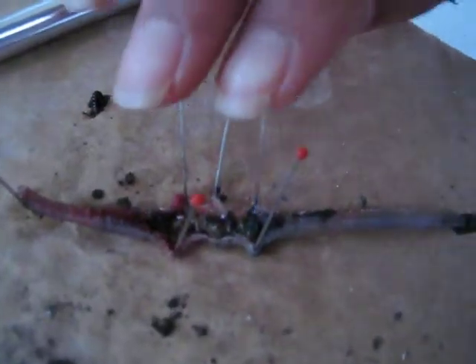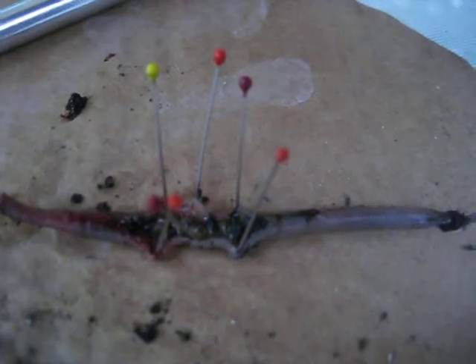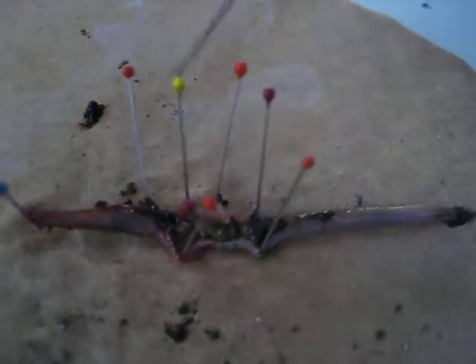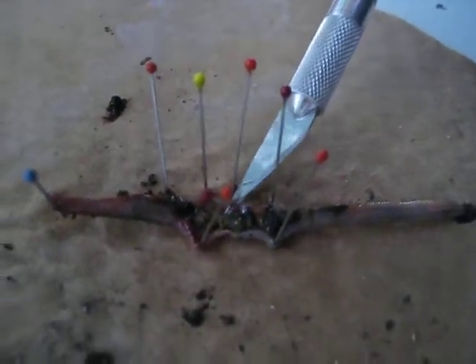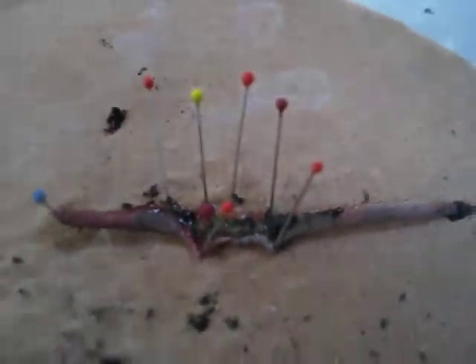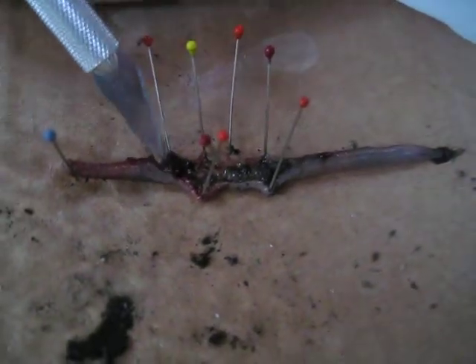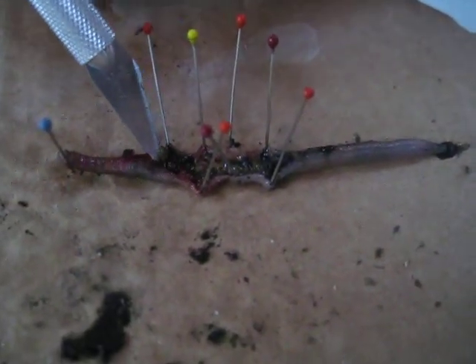By the way, this is Tiffany, who's doing the actual dissecting. That was my attempt — it didn't go very well. Back to this. What is that? That is intestines. Ow, my neck. You can't... it doesn't focus very well inside. I just touched my camera! Just wash it later. You can't wash a camera. Just wipe it off. Eww! It's really bloody.